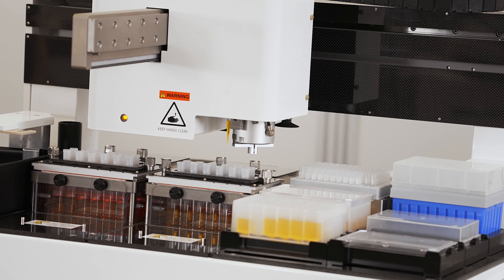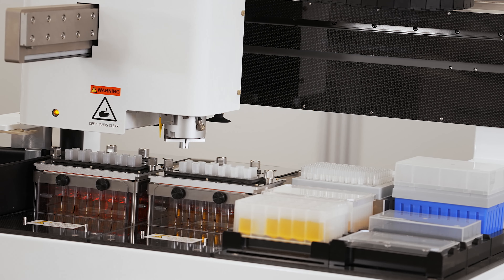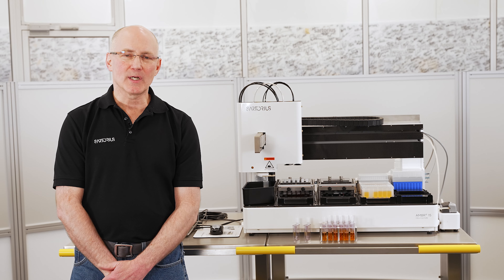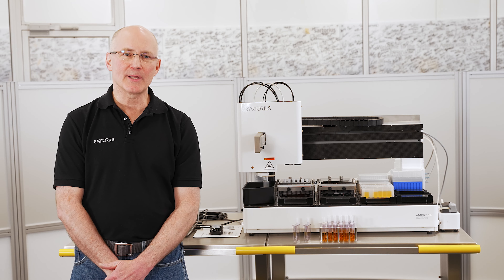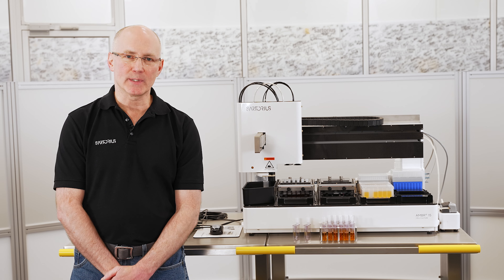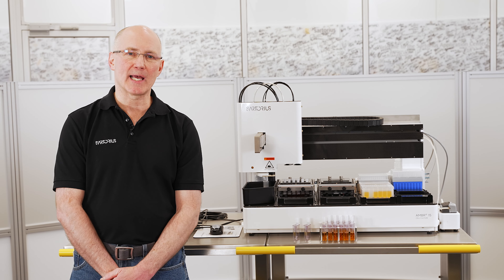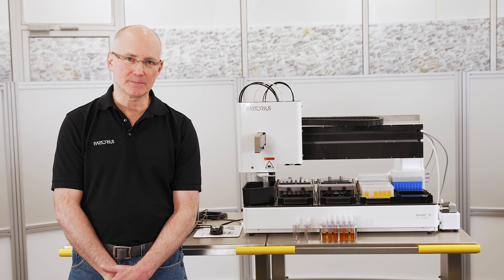It easily fits into a 4- or 6-foot Class II biosafety cabinet for sterile operation. Running parallel high-throughput bioreactors shortens project timelines and consequently time to market, and significantly increases lab productivity. Automated operation ensures bioreactor-to-bioreactor consistency, frees up operator hands-on time, and gives you confidence in your experimental results.